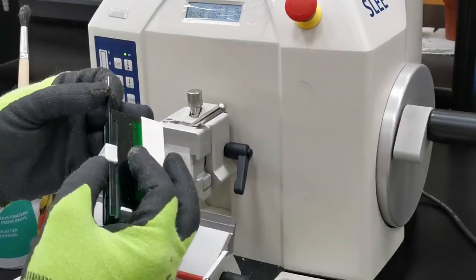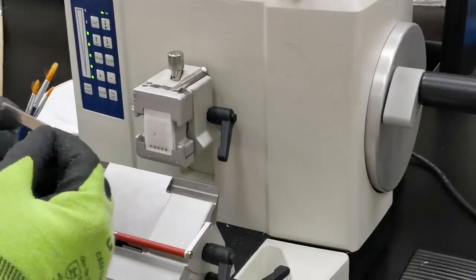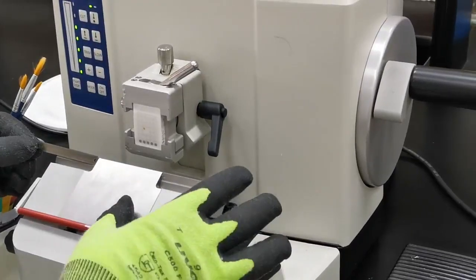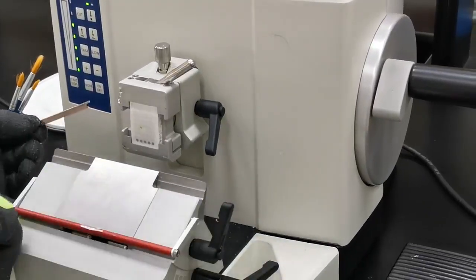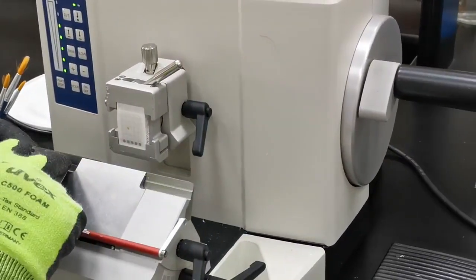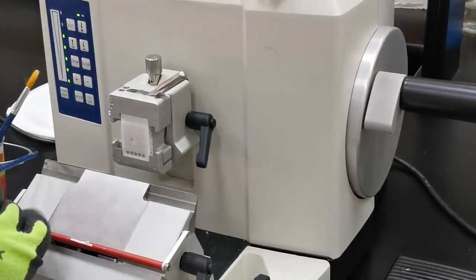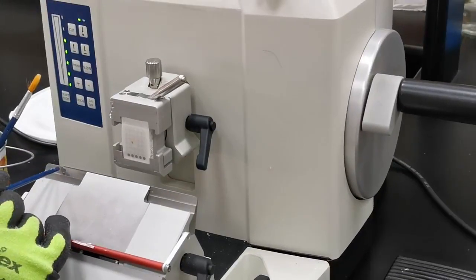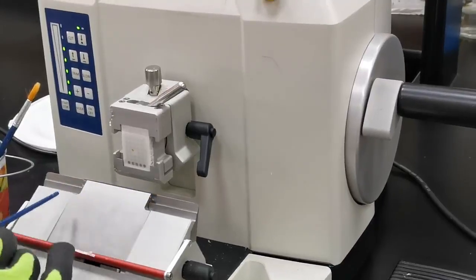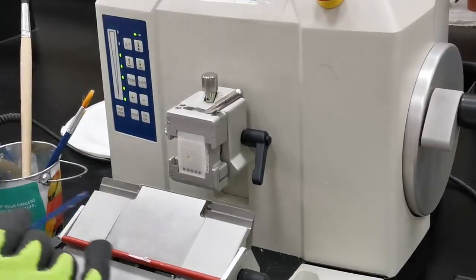Be careful when dealing with the knife. Insert the knife here in the position. Remember it's much better to use wooden sticks when placing the knife in position — never use metal tools near the edge of the knife, as this will make marks on it.